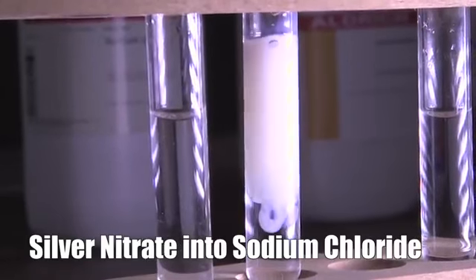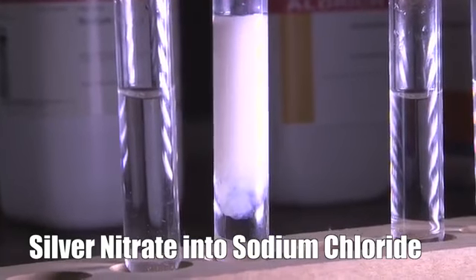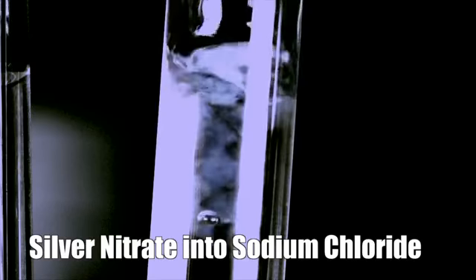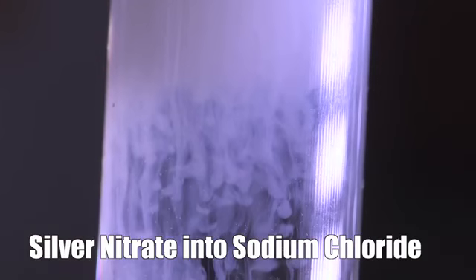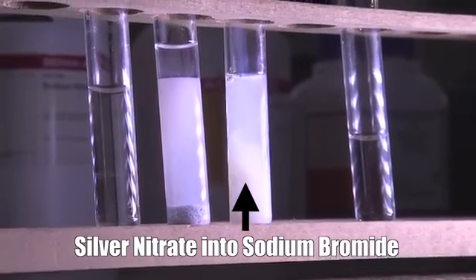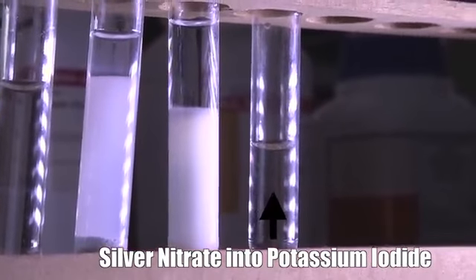With silver chloride, you get a fairly white precipitate. And these precipitation reactions take place incredibly fast, much faster than your eye can follow. This is not something that gradually develops. One minute it's clear, the next minute, boom! Silver bromide is pale yellow, and silver iodide is rather more yellow.